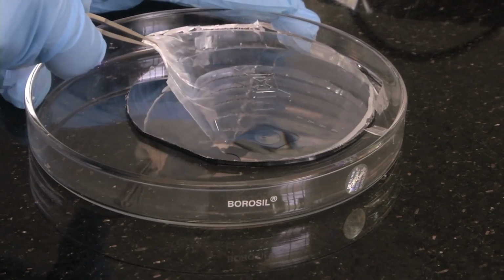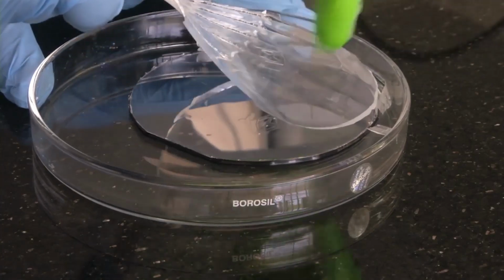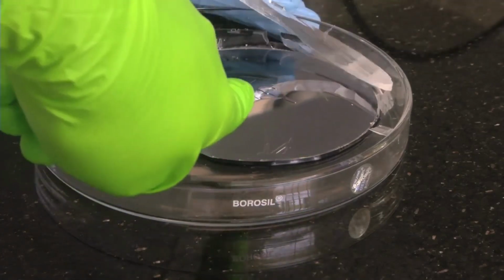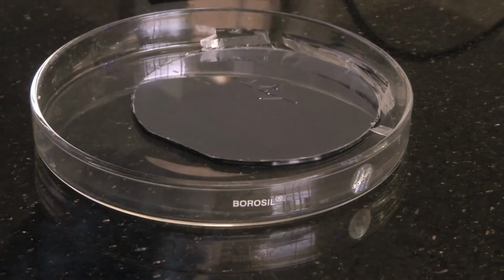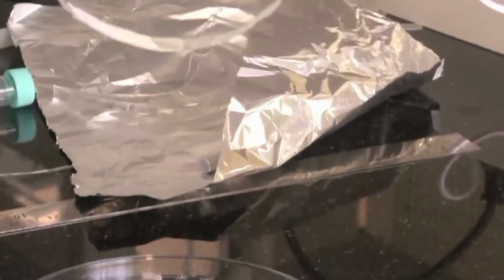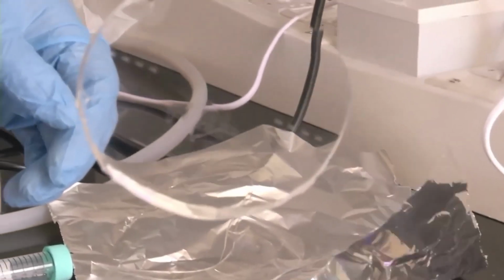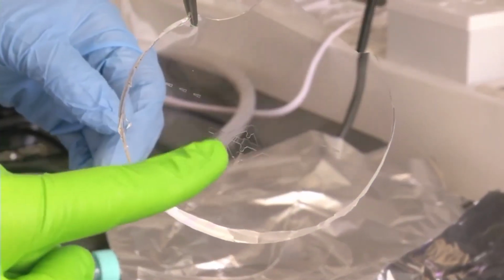So the pattern is there. I think very clearly your pattern is visible here. So see, the pattern has been formed. The pattern that is there on the silicon master has formed on the membrane. Now we will see the membrane's other side to see that the pattern is formed. Yeah, you can see the pattern here.